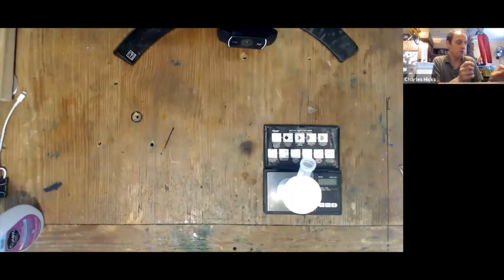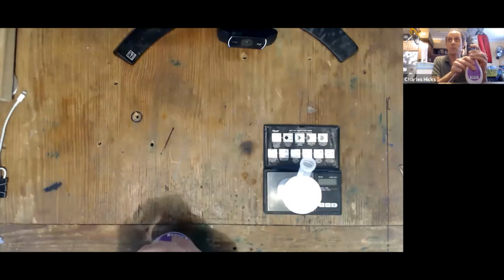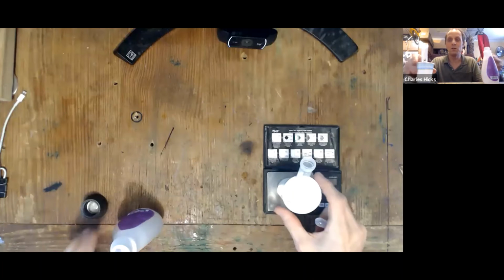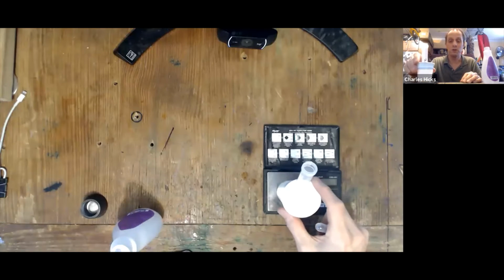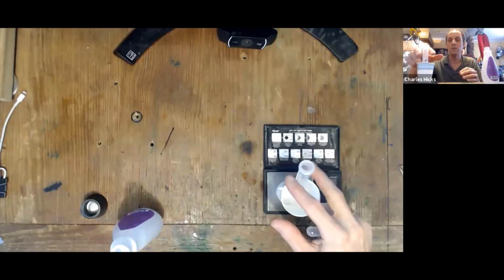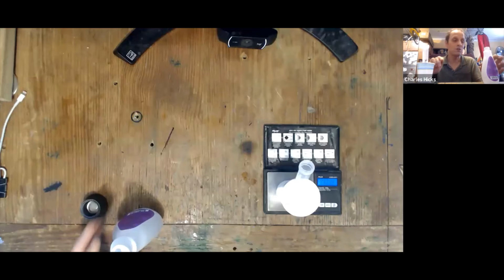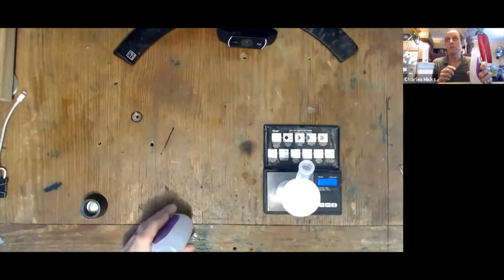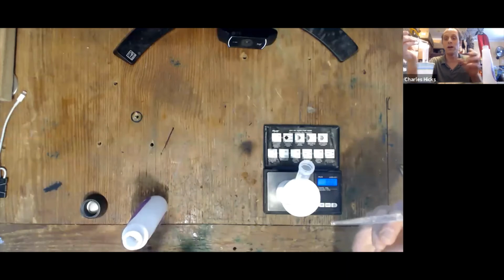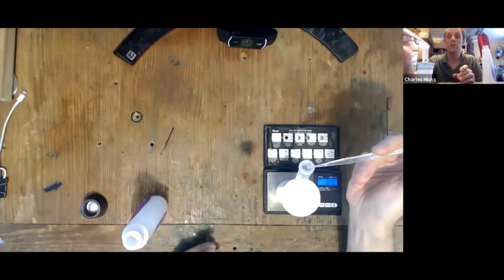So throughout this experimental demonstration, I'm using acetone, but you would do this part of the procedure with your triethyl citrate. So what you want to do is get a Dixie cup or a 100 milliliter plastic container with a screw lid, and use it to stand up a 15 ml test tube. Turn on your scale. It ought to read 0. If it doesn't, you have to tare it. And then you're going to take a clean dropper and count out 100 drops of the triethyl citrate. I'm doing it for acetone. So I'm going to pause the video while I count up to 100.